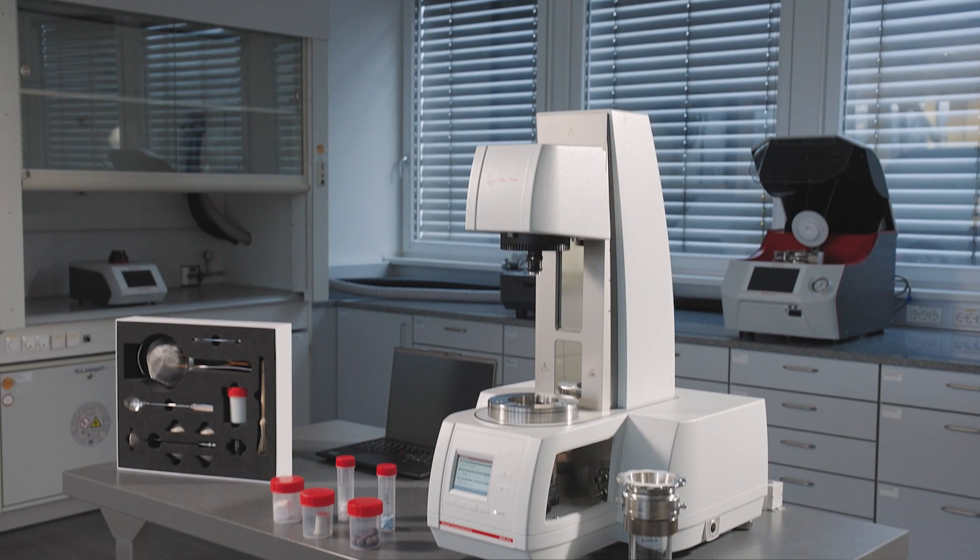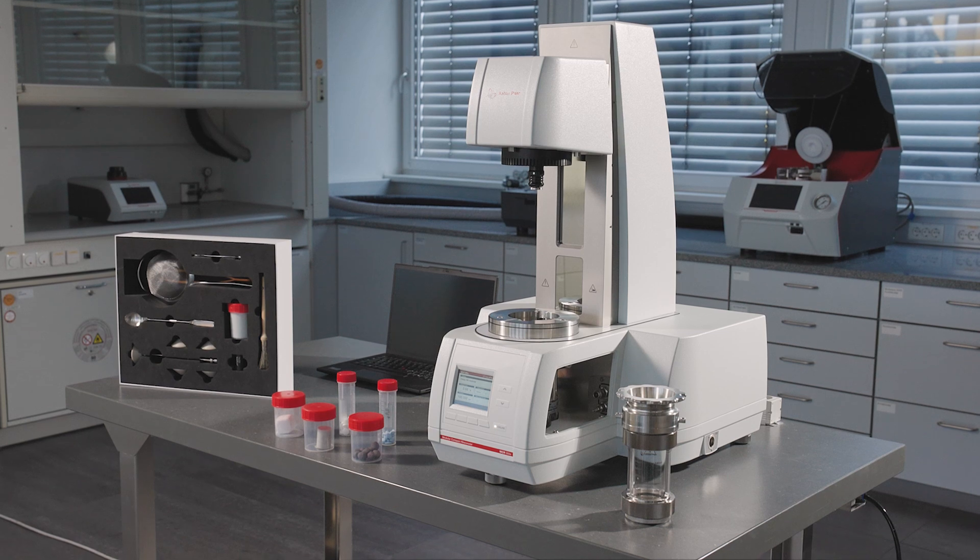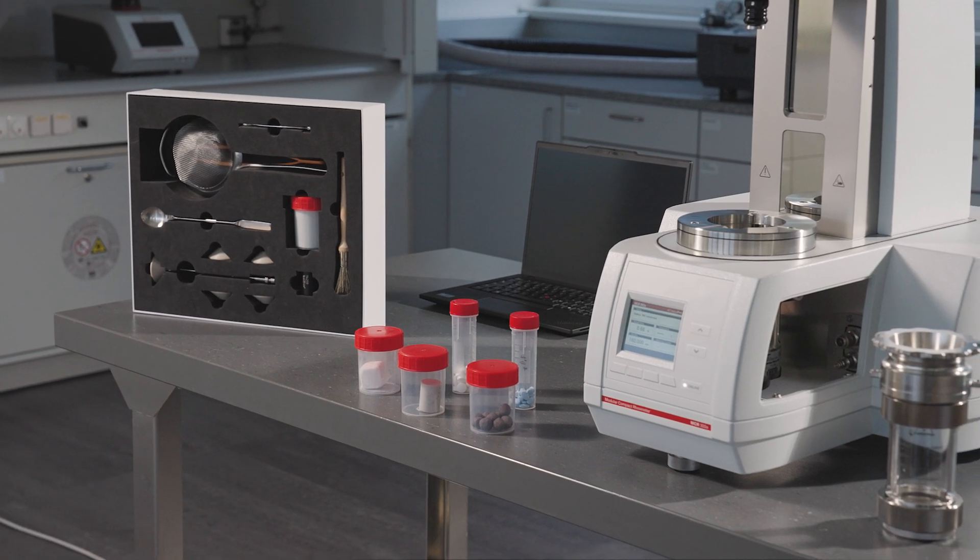In this video, we will show you how to start and operate the envelope density setup for the MCR-XX2E Compact Rheometer Series.